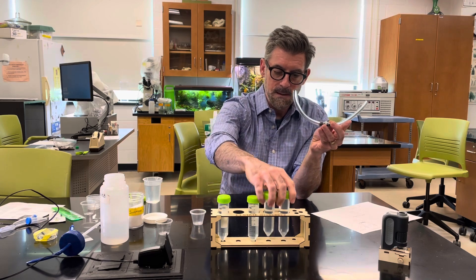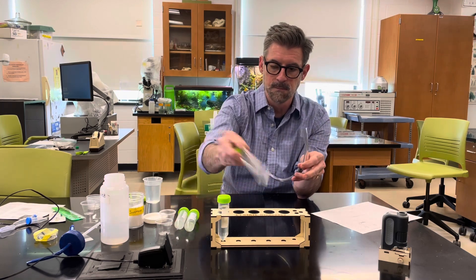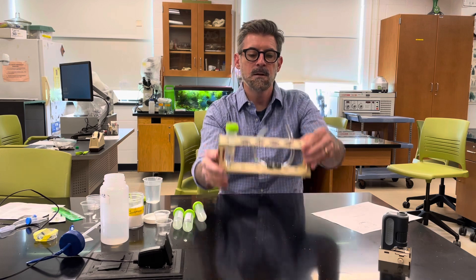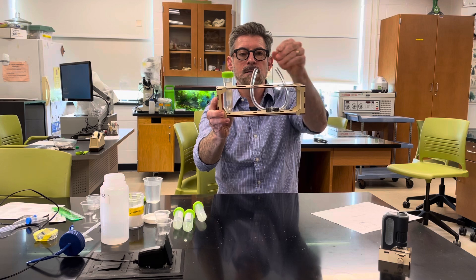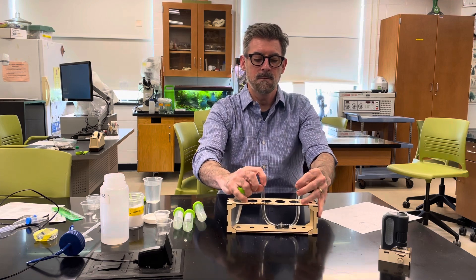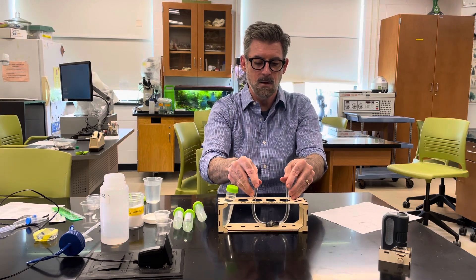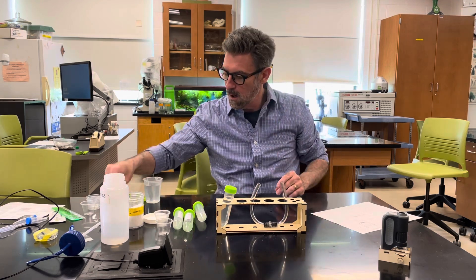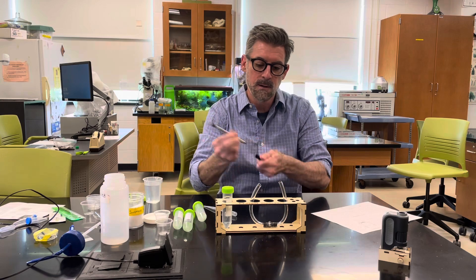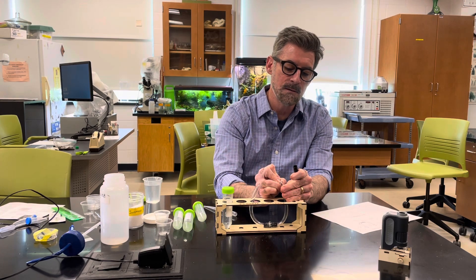This is why labeling is important — you need space to work so the solution tubes go on the table. Feed the U-tube up into your test tube rack and try to straighten it as much as possible to make an even U shape. A little curvature is okay and won't hurt the experiment. Label one side W for water and the other side S for sugar so you remember which is which.